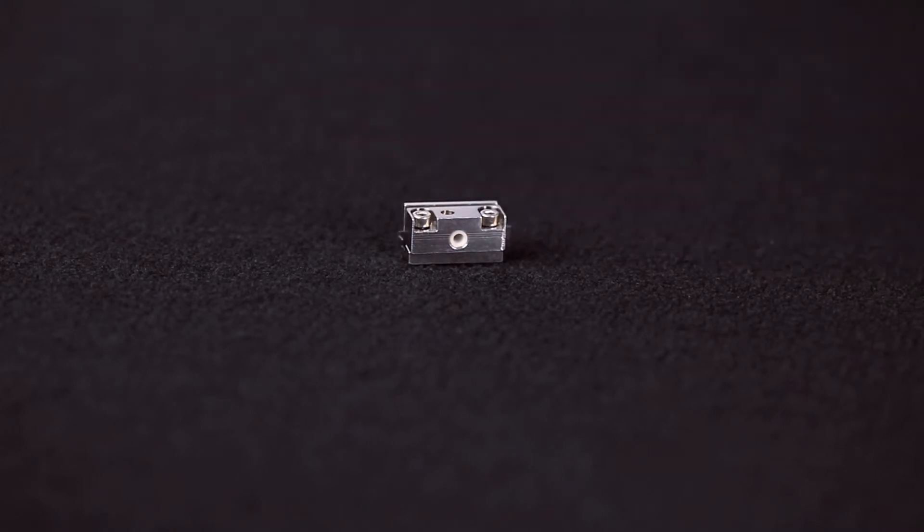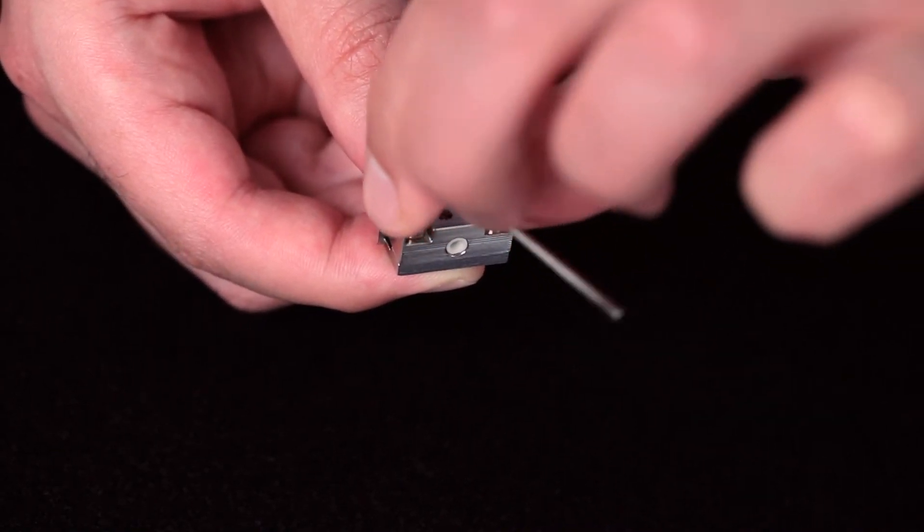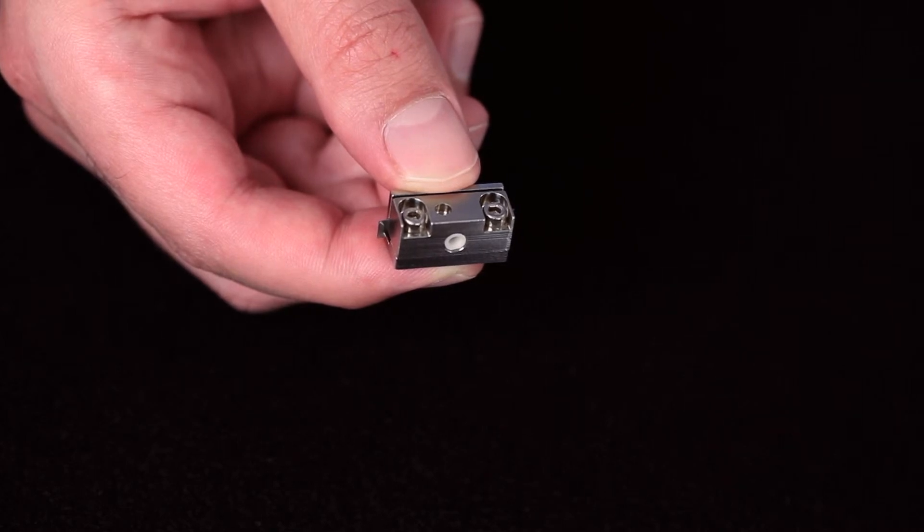Use the 2 millimeter hex wrench and push it down on the sample and tighten the screw. The screw should not be too tight to allow the sample to freely expand.